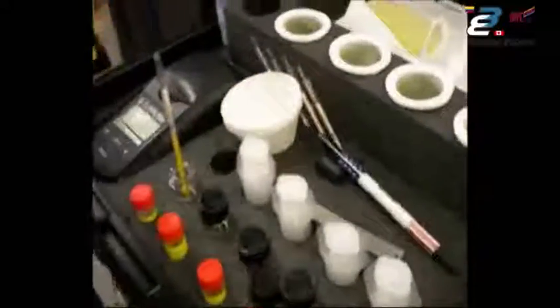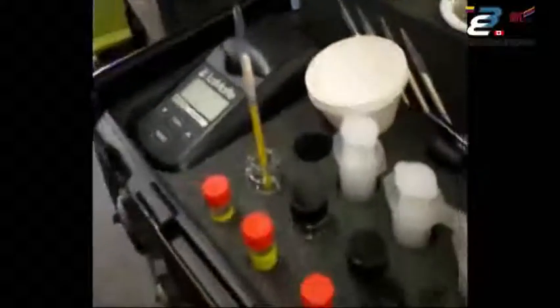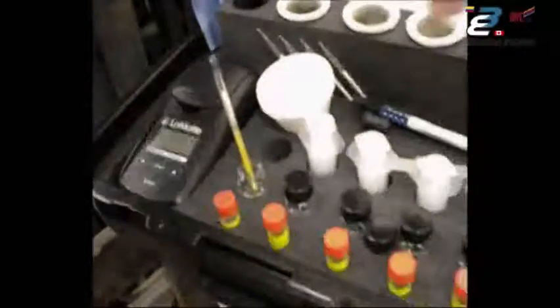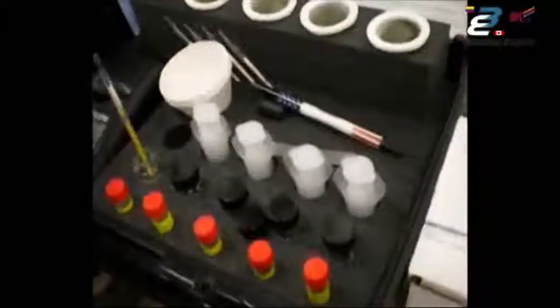It's quite easy to tell — we can see the color change already. So the surface we sampled, even though we did not massage it for the full two minutes just to keep from boring you in this video, we are still picking up nitrates. You can see the extract solution wicking up the titration tube; it takes a minute and a half or two minutes to wick all the way to the top. Like the rest of the components, the nitrate strip is one-time use — throw it away. By using each component only one time, we do not get any cross-contamination from test to test.